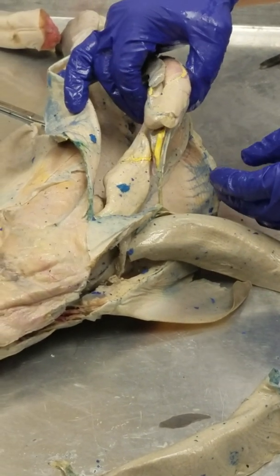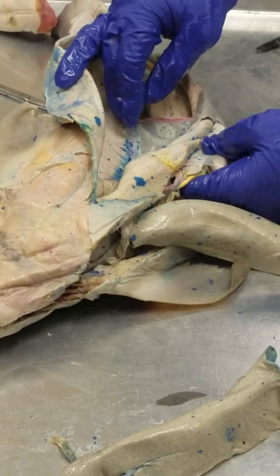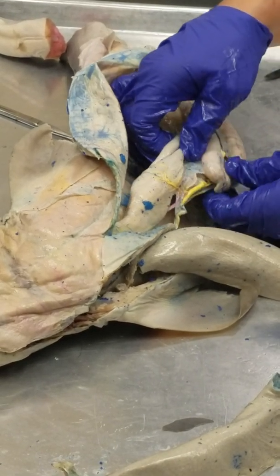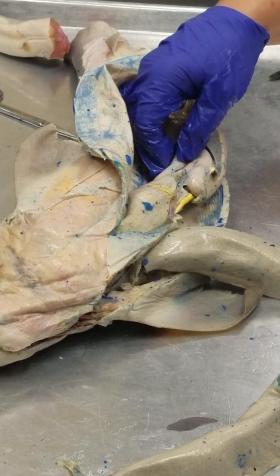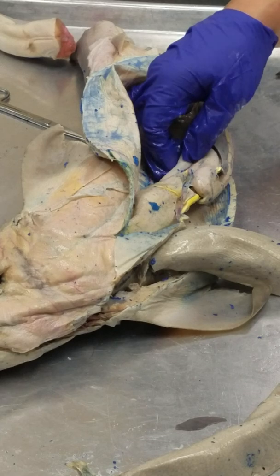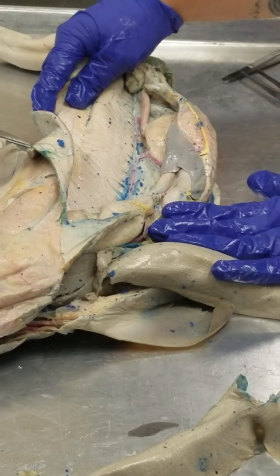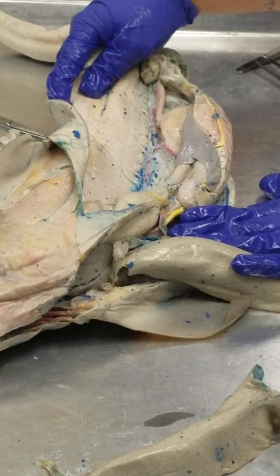What is that for? It's just for holding your organs to the dorsal body wall. So there are a series of smooth muscles that can help tighten those as well. And as we get older, we kind of lose that. So people have a prolapsed rectum or prolapsed vagina, and it's because the mesenteries and the muscles holding them up fail. Oh, like when women get pregnant and like the looseness in the stomach.